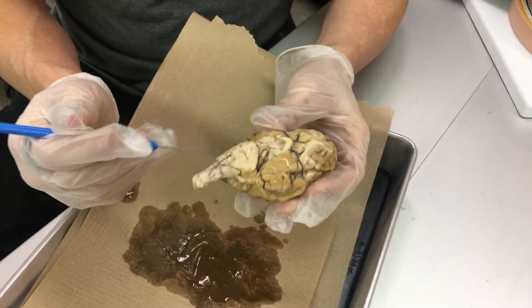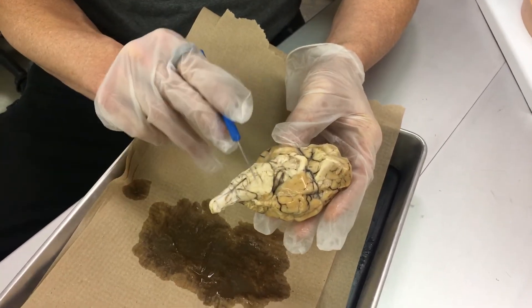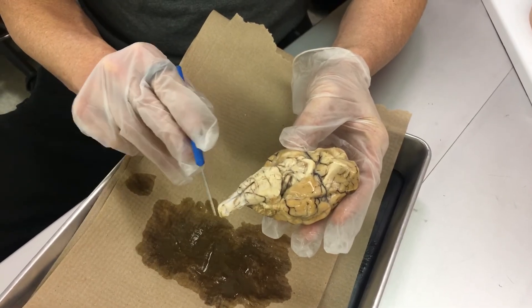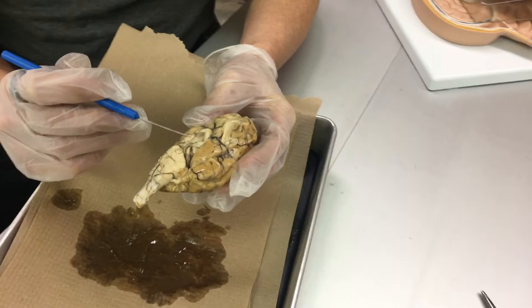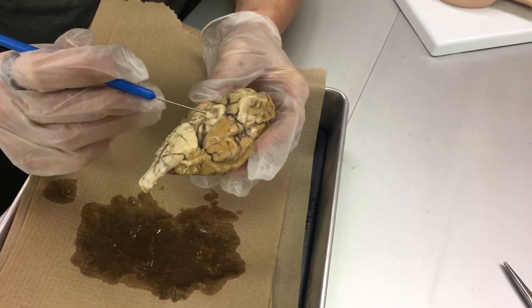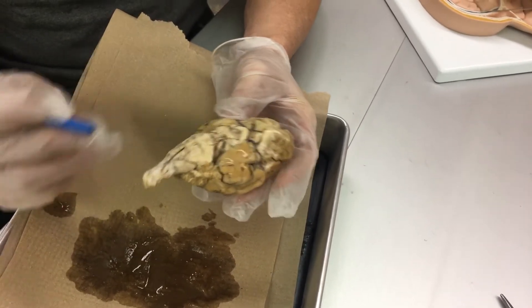With the brain stem, you have the midbrain, pons, and medulla before it goes to the spinal cord. Now the pituitary gland — I think it's kind of smudged — but it should be right in here.